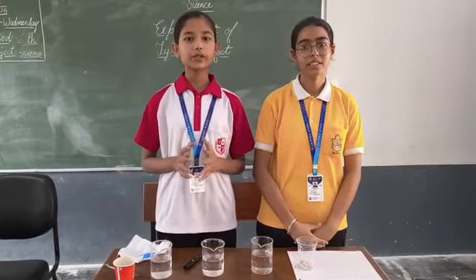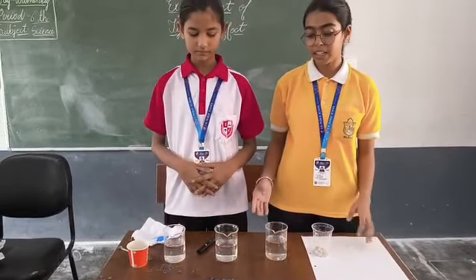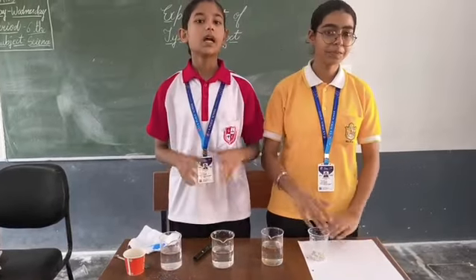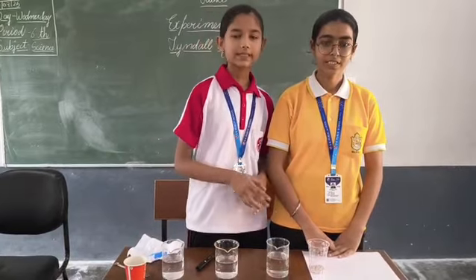This video is here to show you a science experiment named the Tyndall Effect. First, we have taken water in 3 beakers. And we'll make 3 different mixtures: solution, colloid and suspension.